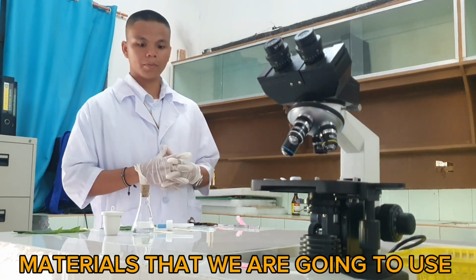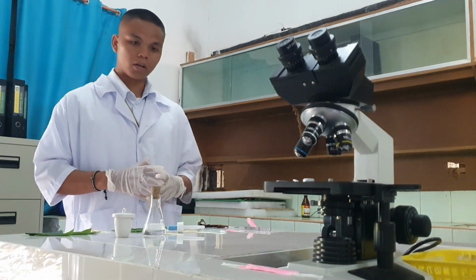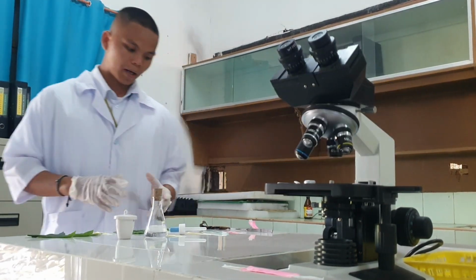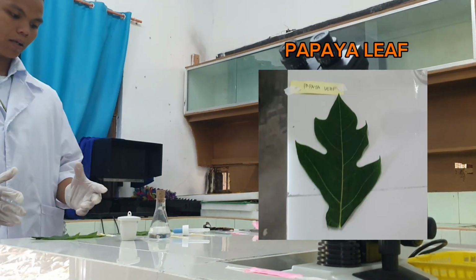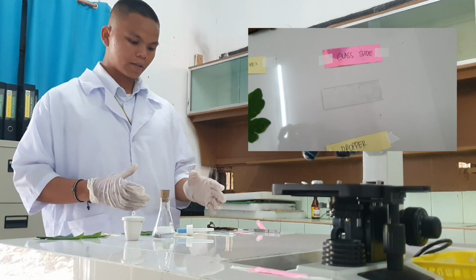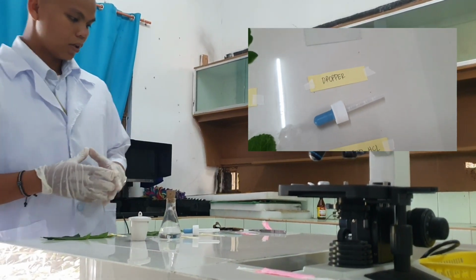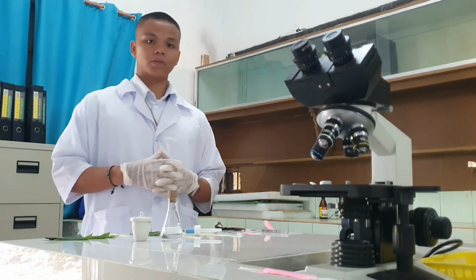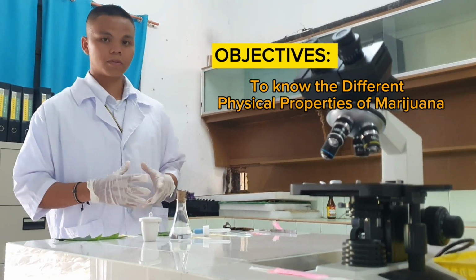Let me introduce you to the materials that we're going to use. We have tobacco leaf, ampalaya leaf, okra leaf, and a papaya leaf. We have a tweezer, a glass slide, a dropper, and a utensil. We're going to identify the different properties of leaves.